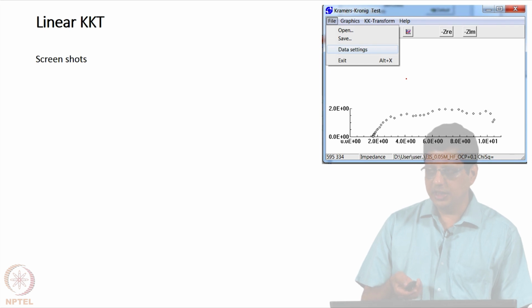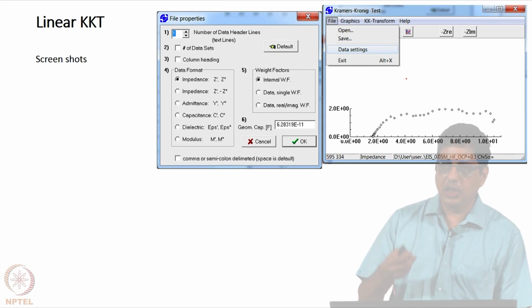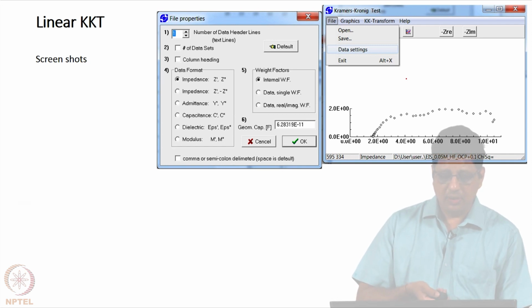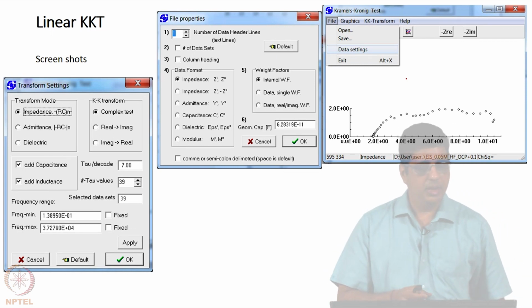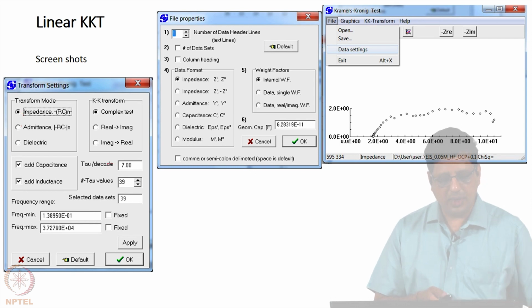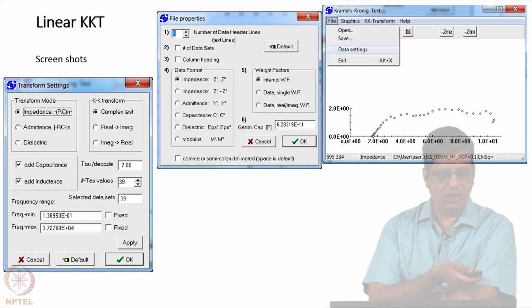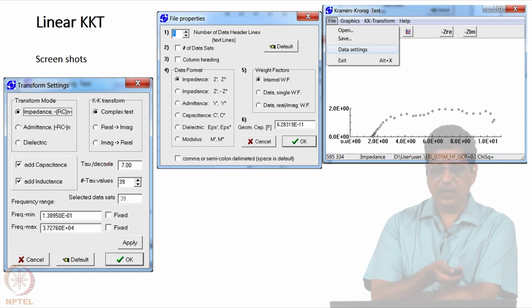first you need to check the data setting so that your data format is given here. Whatever that values are, whether it is number of headers, 1, number of lines, 0. So you can give multiple data sets here, but usually we use one data set for this. You can give multiple spectra, but you have to choose the format correctly and give this. And you normally need to adjust, either it is in the impedance or in the admittance, and tau per decade is what you may need to change. The default value of 7 usually works well. Then you can get the transform data.